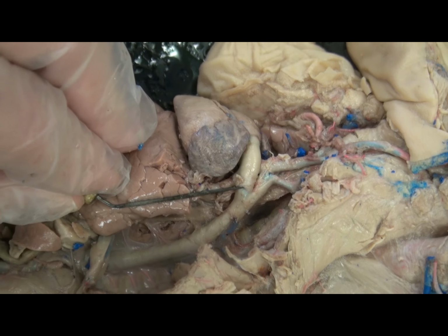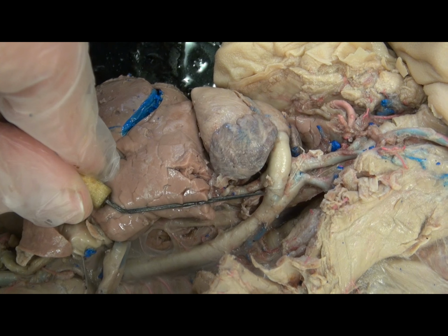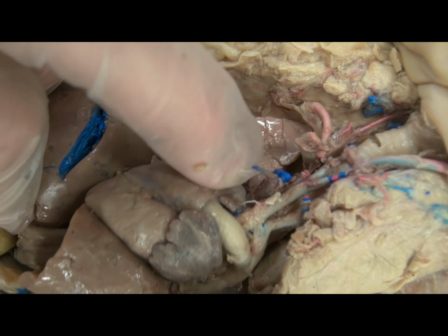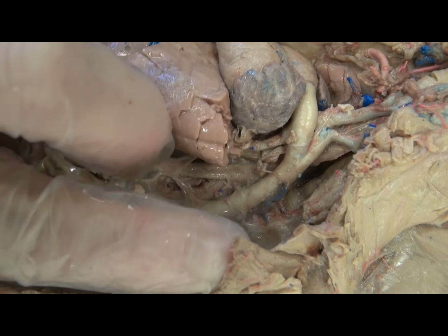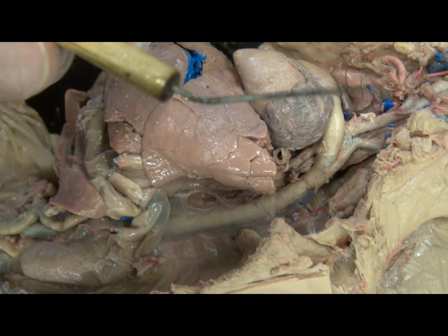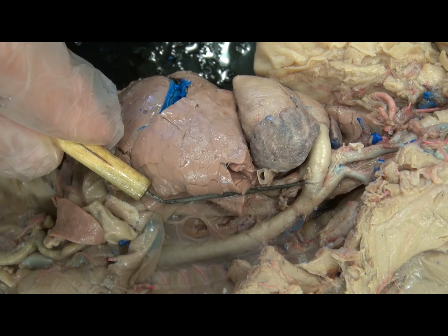It is a shunt through which most of the blood which is in the pulmonary trunk is then sent to the aorta, right? So it is here that the arch of the aorta and the pulmonary trunk's ductus arteriosus fuse before forming the descending aorta. And so this will close in adults and form a ligament, the ligamentum arteriosum.